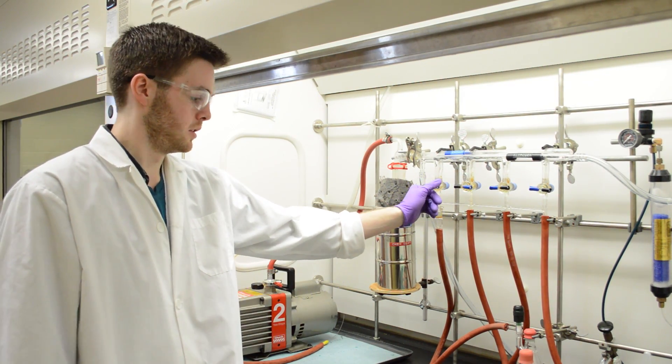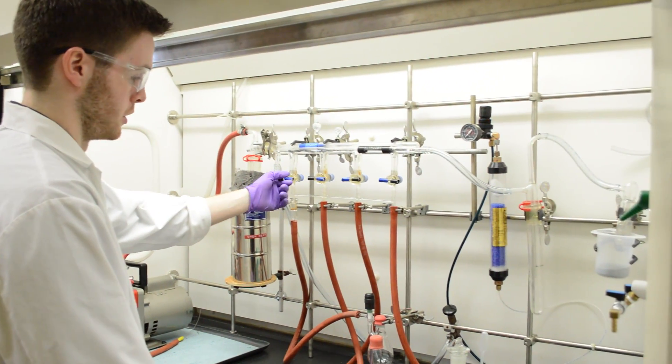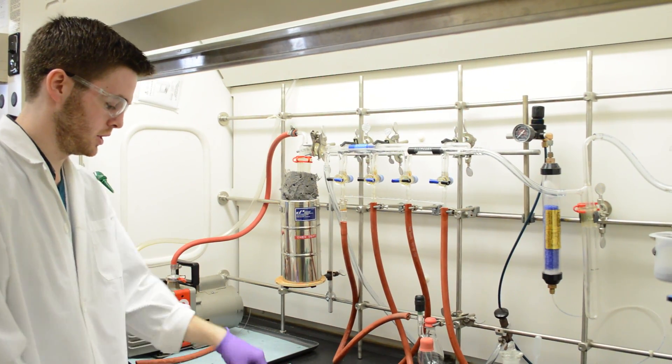All right, so that doesn't take very long, and then we can switch this over to nitrogen if we want to blow it over the system, but of course we don't just yet.